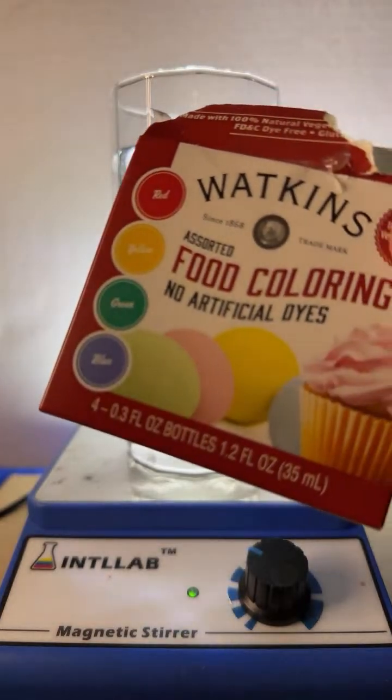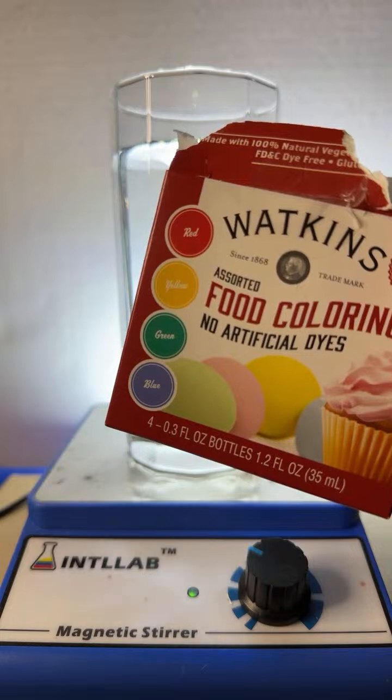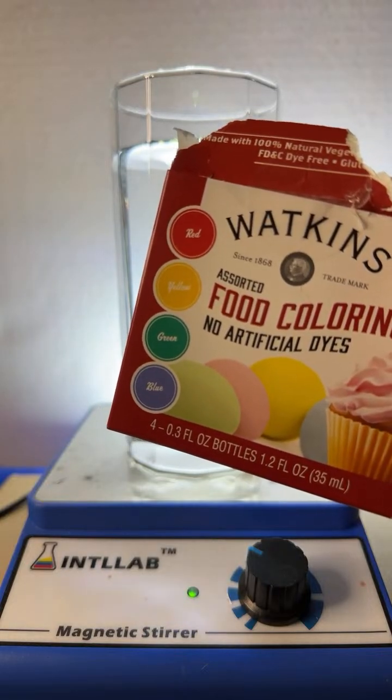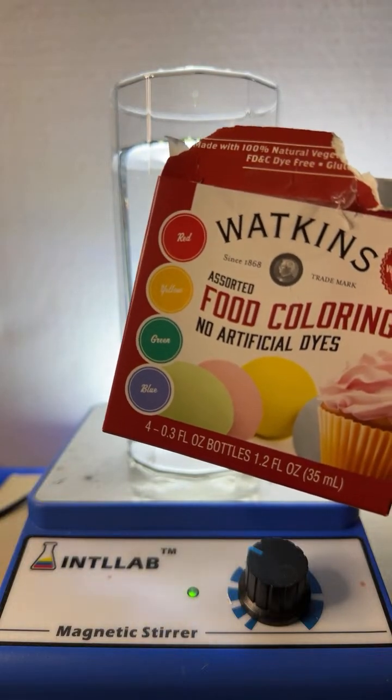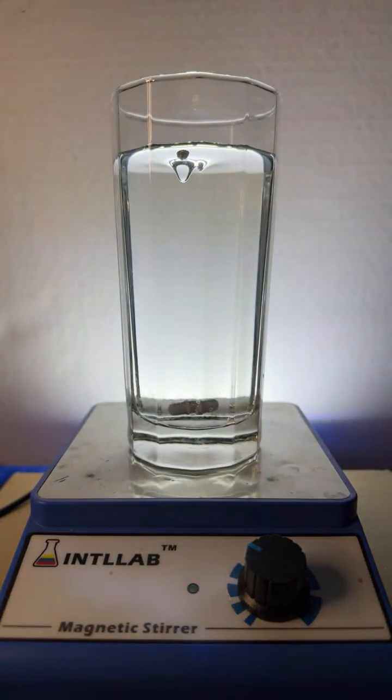Riker Kelly wants to go blue. We're going to do that next. And Riker, the reason why I'm holding off on the blue is the color shift there is kind of subtle. You know what? Riker Kelly wanted blue, so we're going blue. Why am I going to do what I want to do? I want to do what the viewers want to do. So, okay. We're going to try the blue. We're going to see what happens. So in it goes.